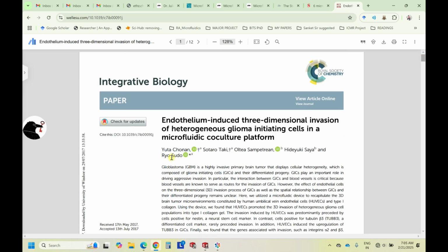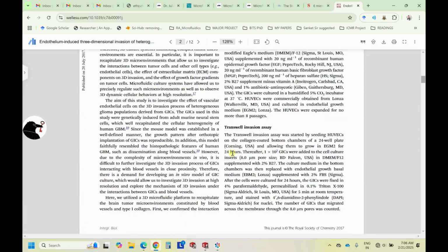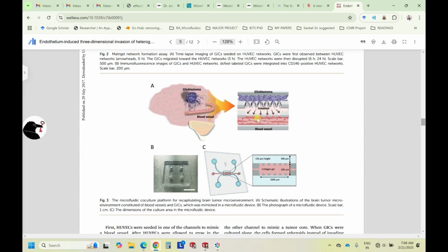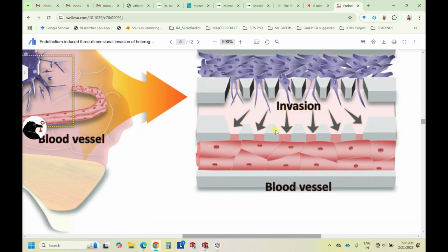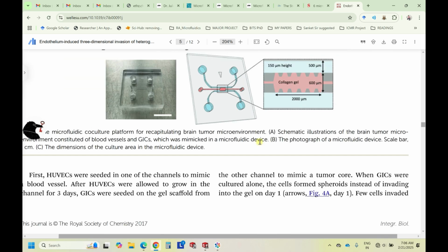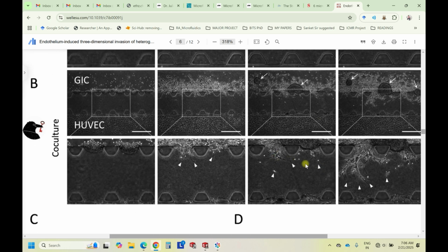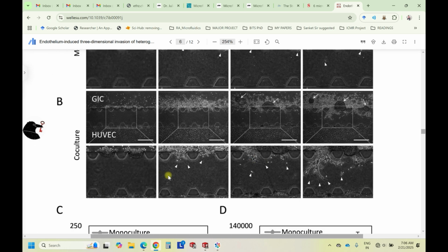So this is the article by Yuta Chonan, about inducing or monitoring the three-dimensional invasion of heterogeneous glioma cells in the 3D microfluidic platform. So when I went through this, I found that the design is not as shown in the review article, but it is something like this, whatever we have designed. So you'll have the pillars standing, and in between the grooves, the cells will go and set. So just to confirm, I'll show you some microscopic images. So if you see these images, this is how the pillars are standing, and this is where the cells are incoming into the 3D microfluidic channels. Right, I hope this is clear.